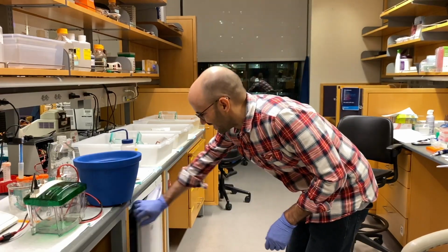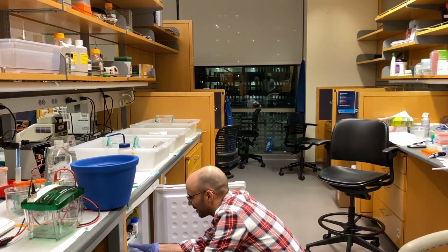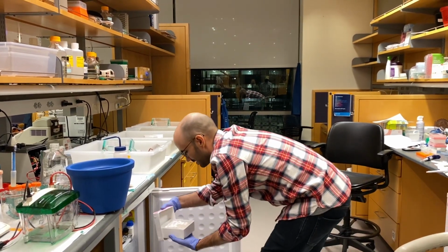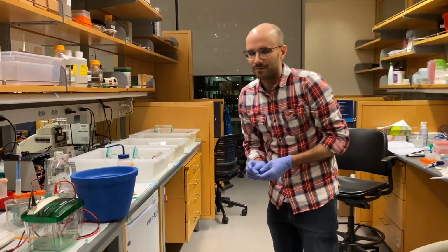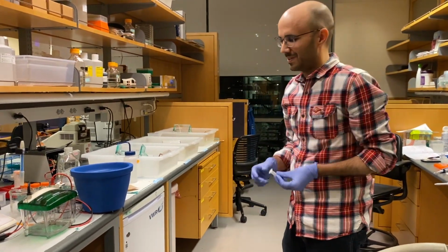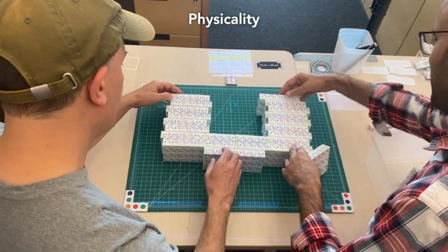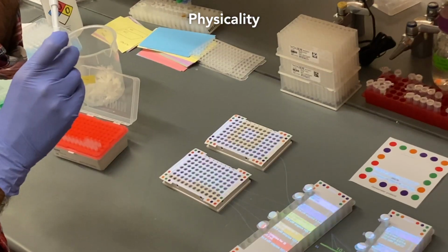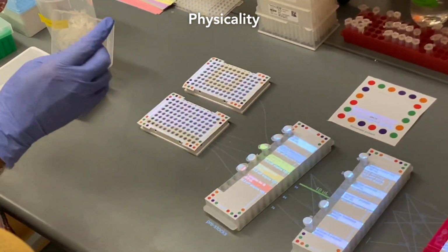Now at the end of the project, we might put some of these tubes in the freezer, and years later, maybe we take one out, put it on the bench, and we would expect to see immediately from the tube the protocol that generated it, as well as the origami designs, the data we later collected, the paper that was published, all that could be attached to the physical test tube. So physicality is one of the key concepts that we're leveraging here. Using our hands, designing 3D structures using 3D models, seeing what's physically in test tubes. Molecules in test tubes are physical things, so we'd like our computation out in the physical world where the science is happening.